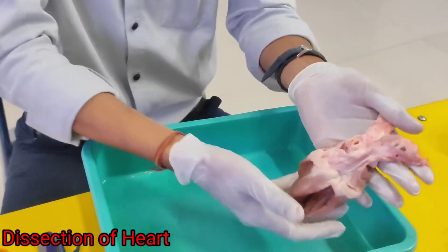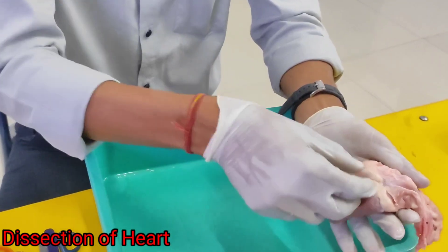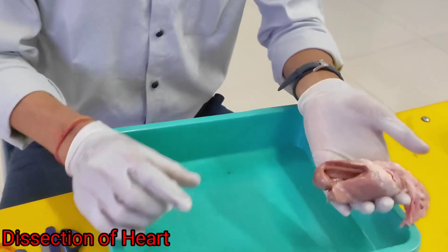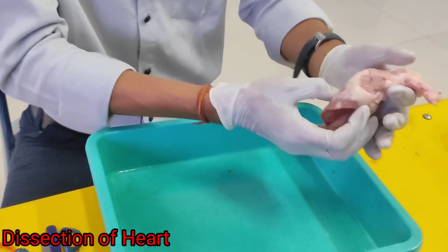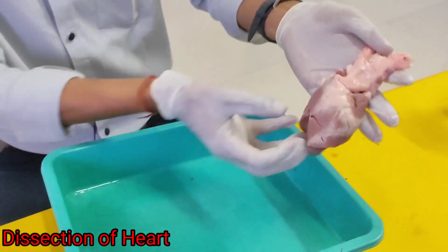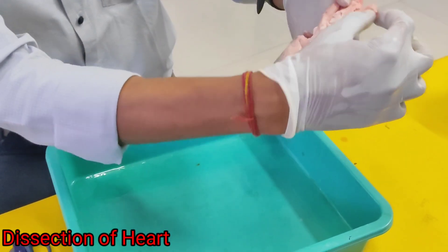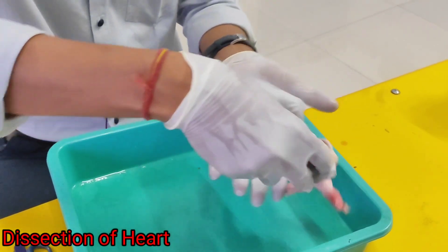So you can see this is the structure of the heart. All the divided things you see here are the coronary arteries and coronary veins. These coronary arteries and coronary veins are joined together across all sections of the heart. On the back side portion, you will see the atrium and the ventricle — this is the thick part. The back side shows where blood is transported all over the body and returns to the heart. This is all about the heart structure.